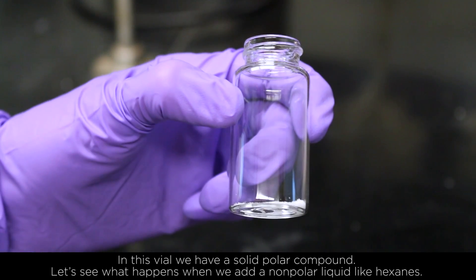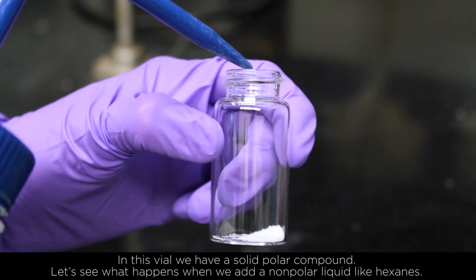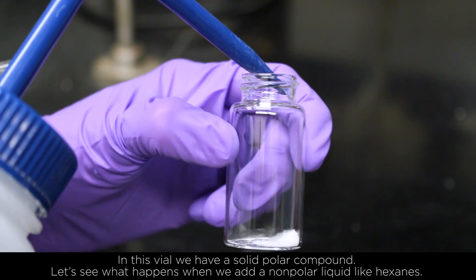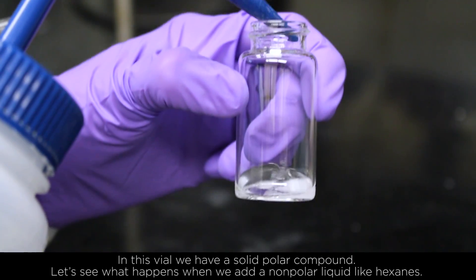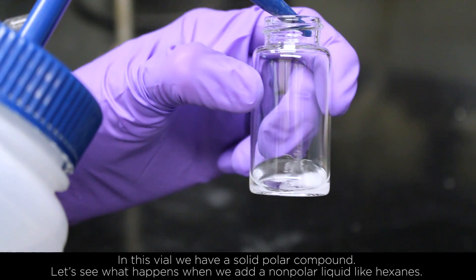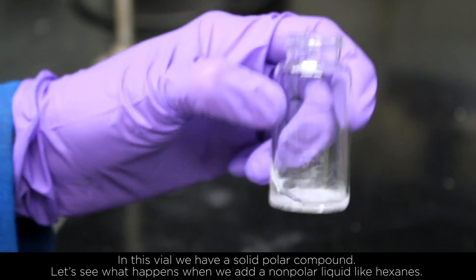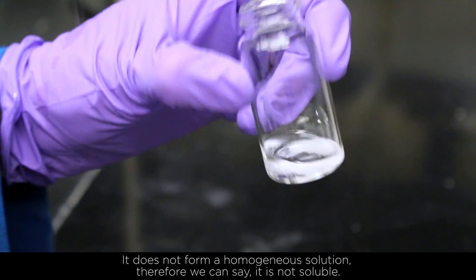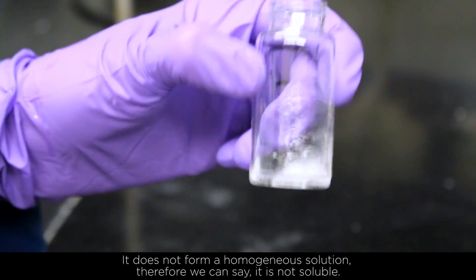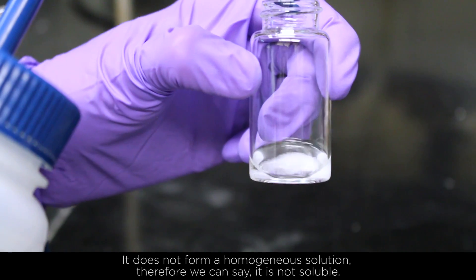In this vial, we have a solid polar compound. Let's see what happens when we add a non-polar liquid like hexanes. It does not form a homogeneous solution; therefore we can say it is not soluble.